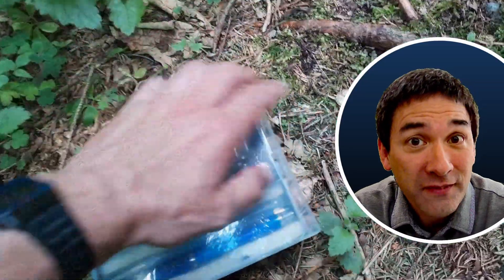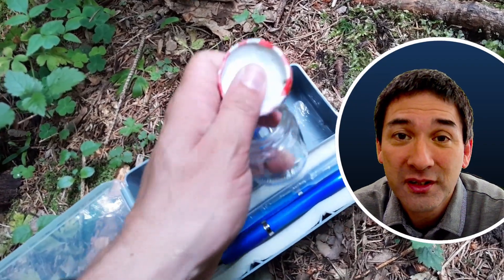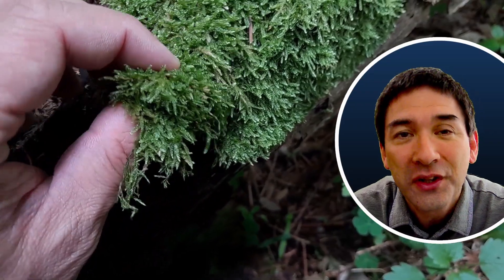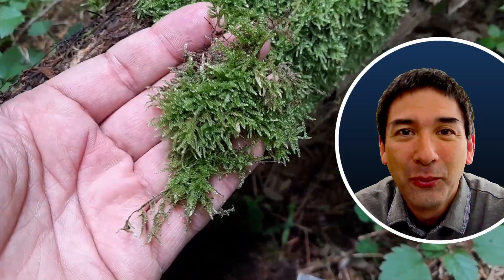I visited a forest several days ago and I always take along my sampling container with some jars, tweezers, and scissors. I found a very nice lush green moss growing on a decomposing wooden log and I took some of it along simply to observe what I'm able to find there. That's me here in the forest — it was a very nice day, quite temperate, and that's important.